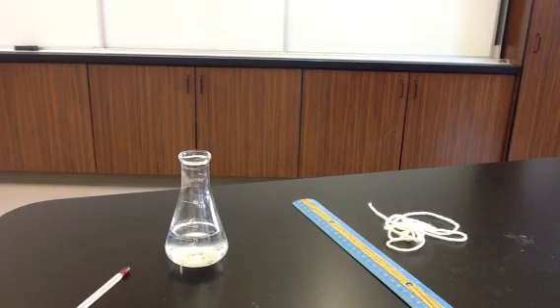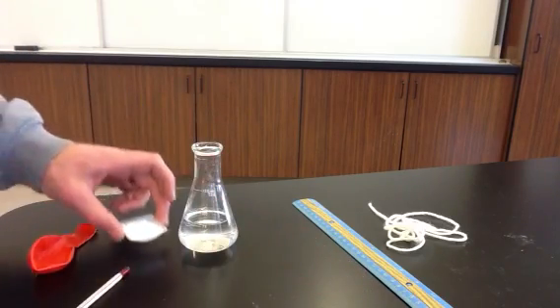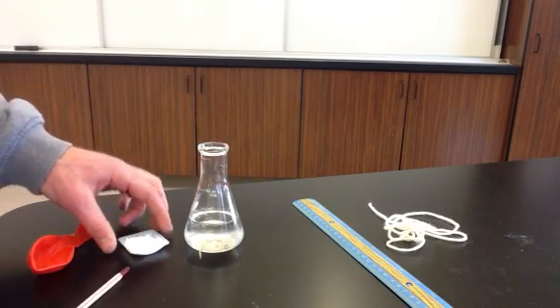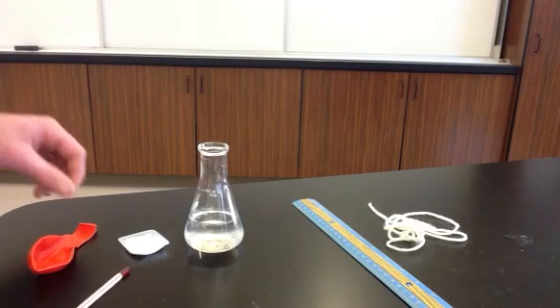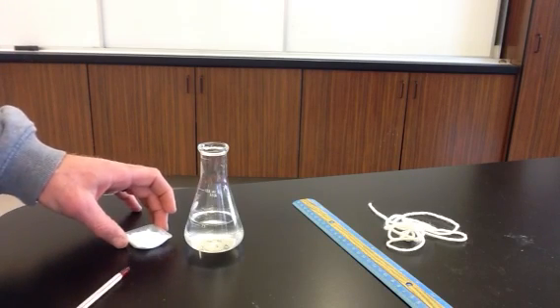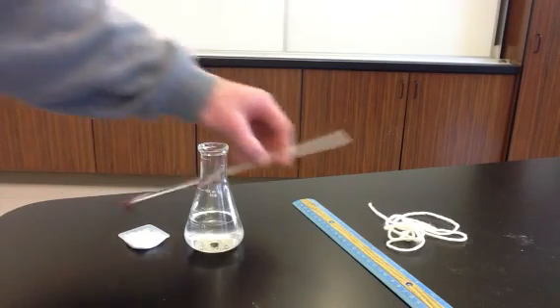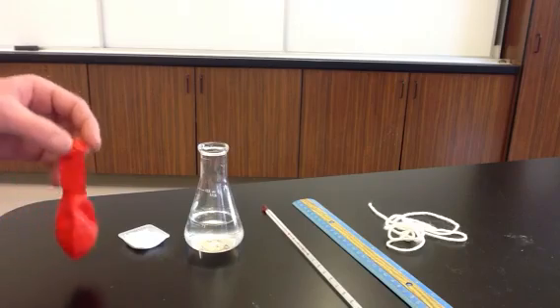So in this lab, we're going to be generating carbon dioxide gas. We're going to do that by a reaction between sodium bicarbonate and acetic acid. The sodium bicarbonate and acetic acid react together to produce carbon dioxide gas. That carbon dioxide gas is going to be collected inside of a balloon, and we're going to measure the volume of the balloon. We'll use stoichiometry to calculate how much gas was produced, and we'll measure the temperature, and then we can use PV = nRT in order to find the pressure in the balloon.